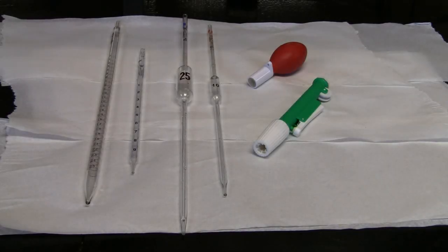A pipette is used to dispense a precise volume of liquid. It must be used together with a pipette bulb or pipette pump. Pipettes take practice.